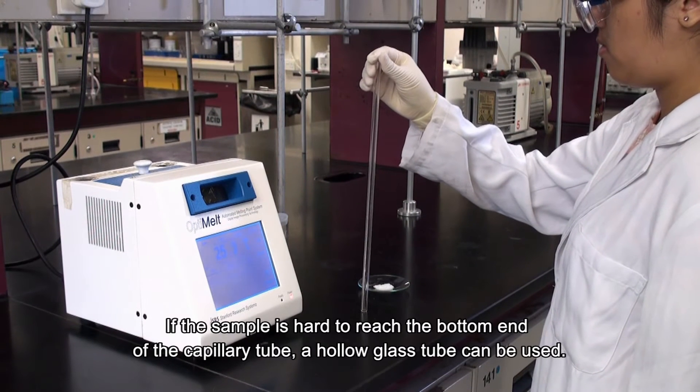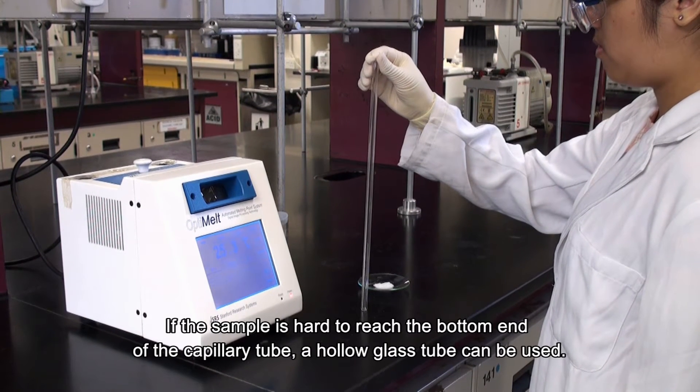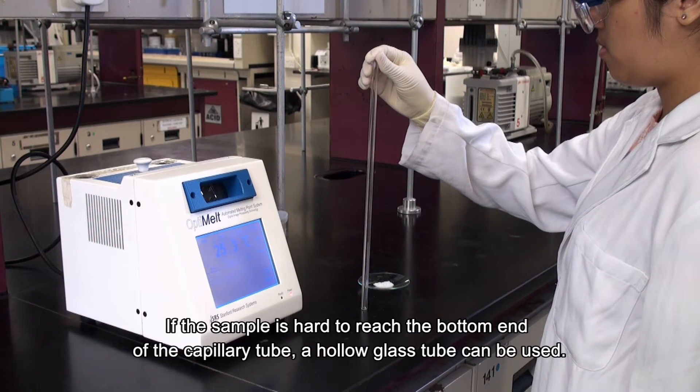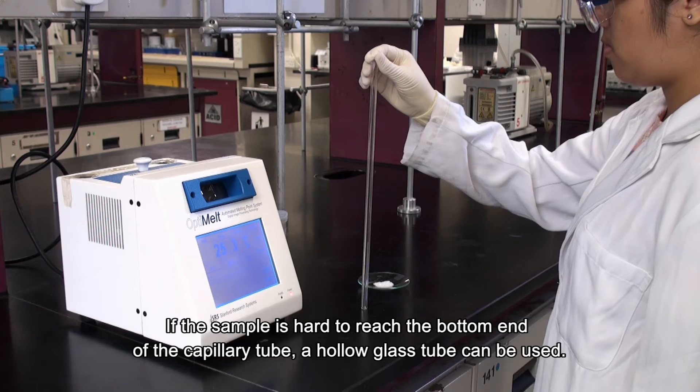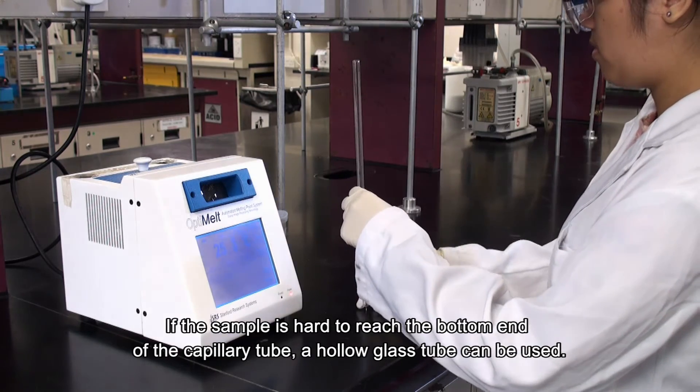If the sample is hard to reach the bottom end of the capillary tube, a hollow glass tube can be used.